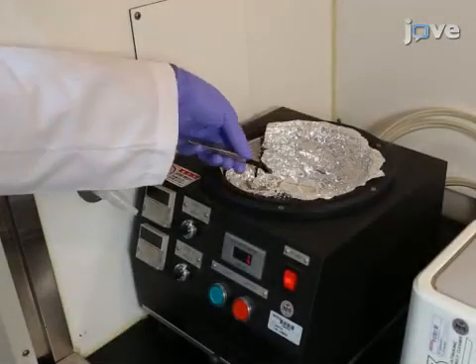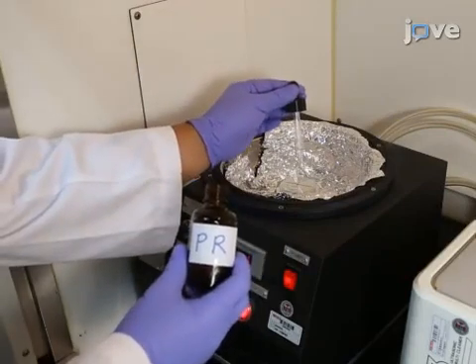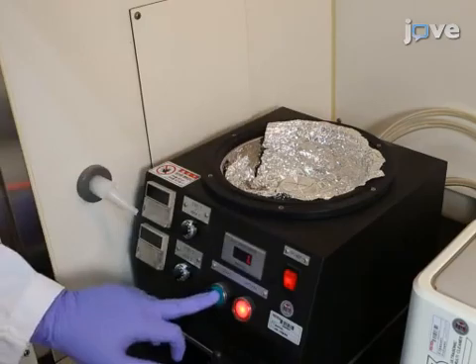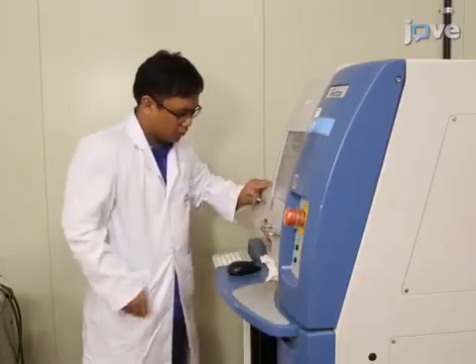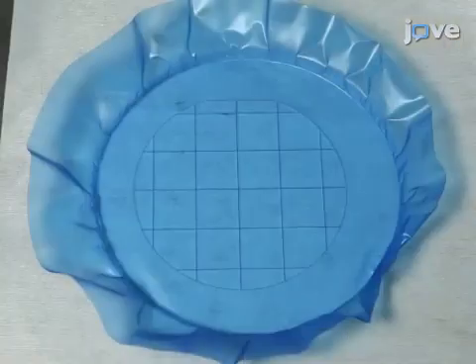To begin, spin coat the quartz wafer with a positive photoresist at 2000 rpm and bake for 60 seconds at 90 degrees Celsius. Then, use a dicing machine to cut the wafer with photoresist into small pieces 20 by 20 square millimeters in size.